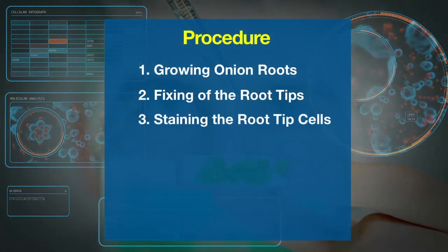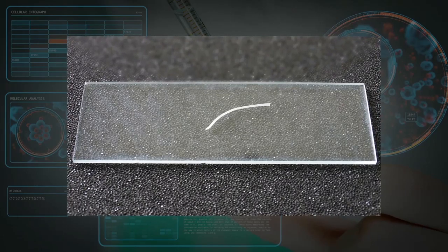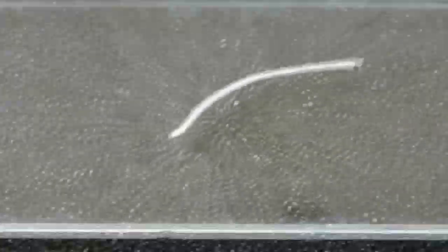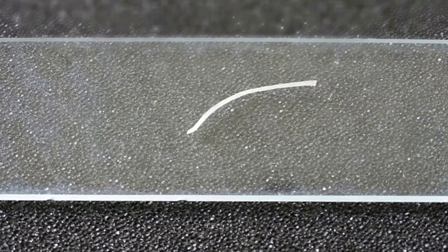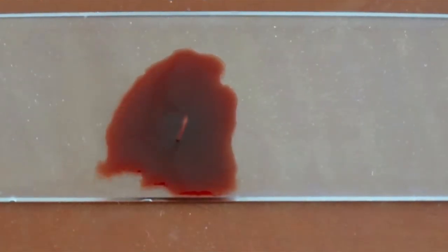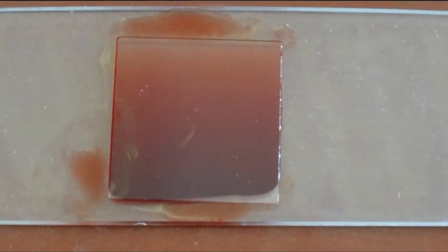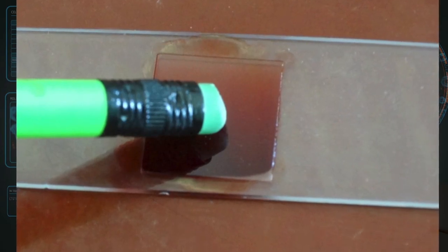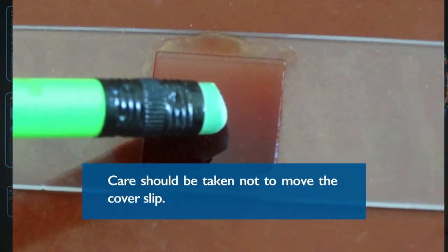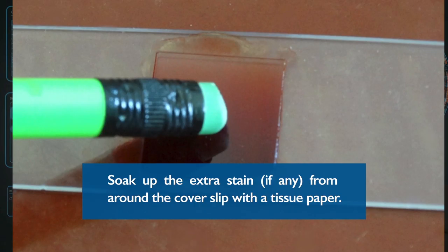The next step is staining the root tip cells. Take out a root tip with the help of forceps and place it on a microscopic slide. Trim the extra end of the root tip to keep only the root tip part of about 2 mm. Now add 2 drops of aceto-orcein stain on the root tip and keep for 2 minutes. Place a cover slip on the drop of stain containing the root tip and gently squash it by pressing with the back of a pencil eraser. Care should be taken not to move the cover slip. Soak up any extra stain from around the cover slip with a tissue paper.